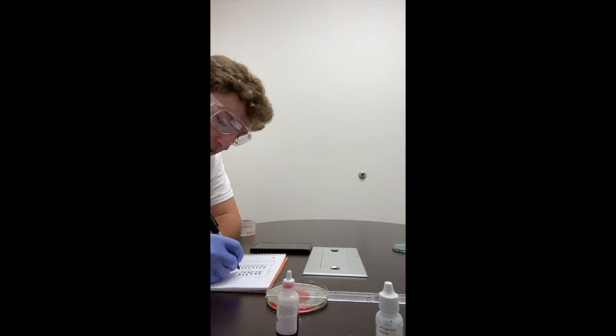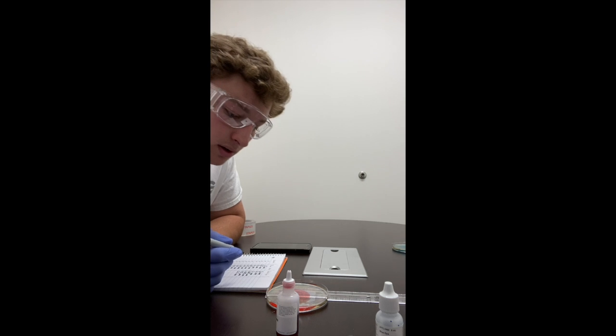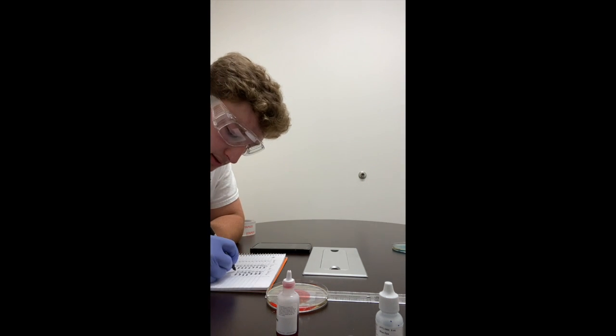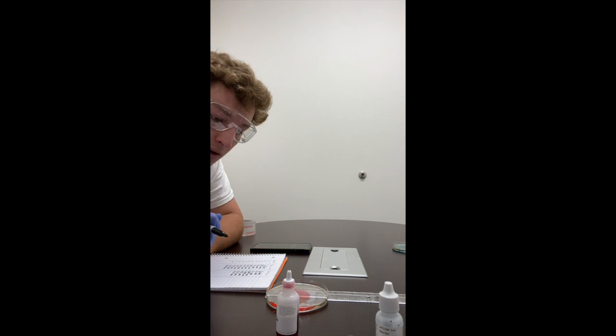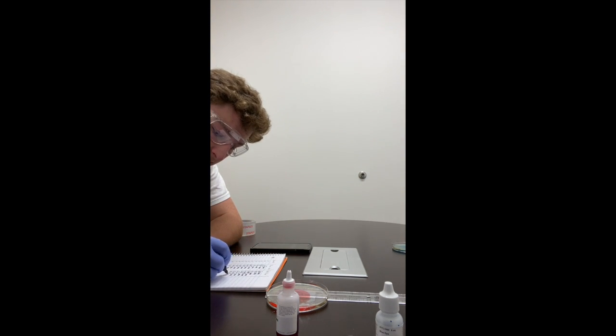At 70 seconds, it is still at 6.5 centimeters. At 80 seconds, still at 6.5 centimeters. 90 seconds, it is still at 6.5 centimeters.